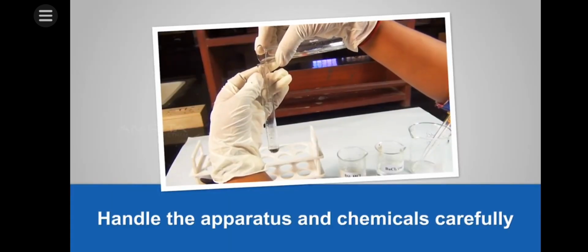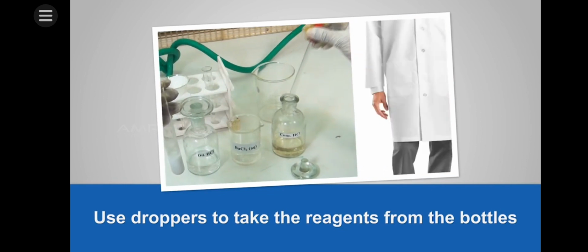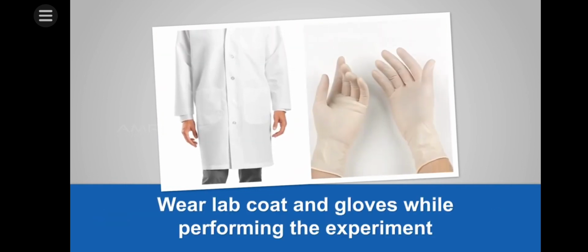Precautions: handle the apparatus and chemicals carefully. Use droppers to take the reagents from the bottles. Wear lab coat and gloves while performing the experiment.